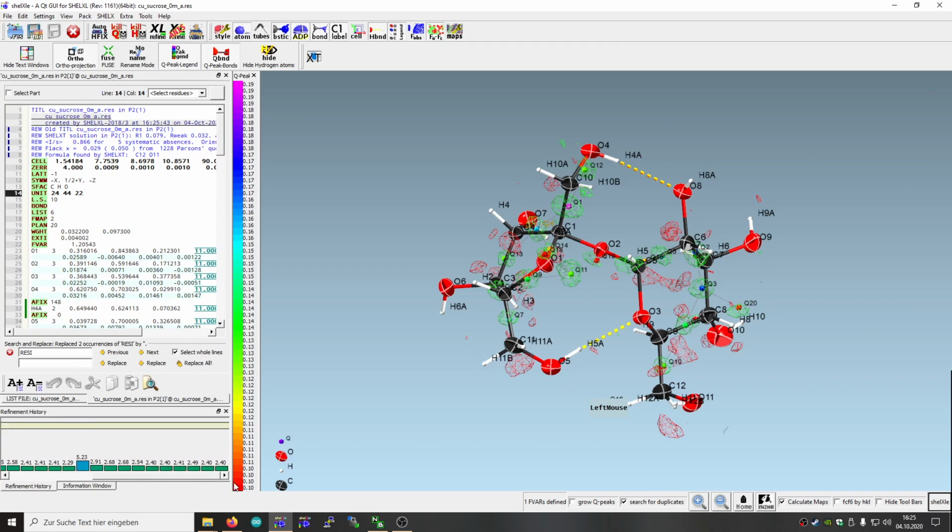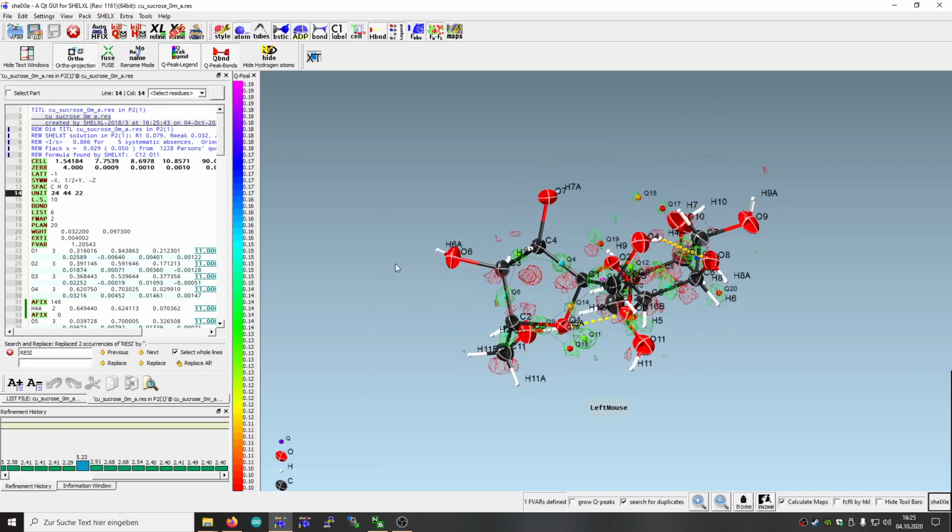Let's see. So we see we started at that R value, and finally we got to 2.4%. Not too bad. And so this was it.